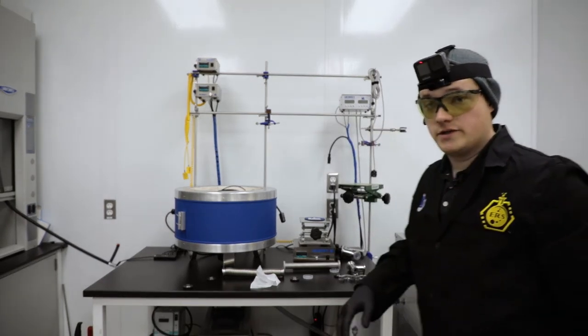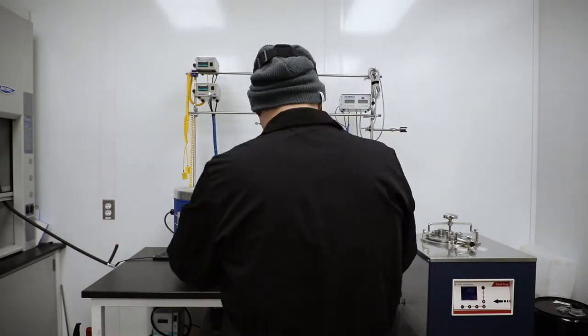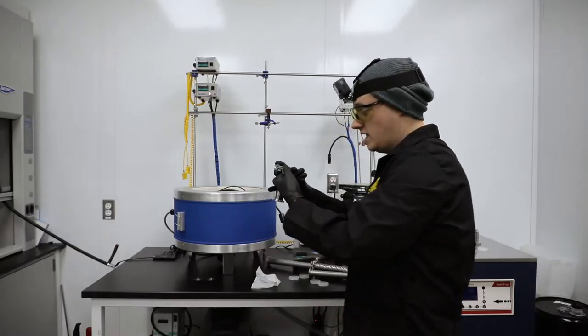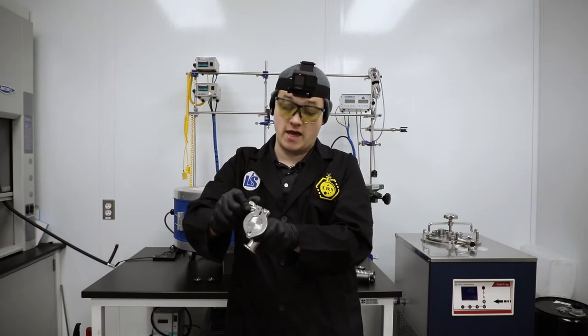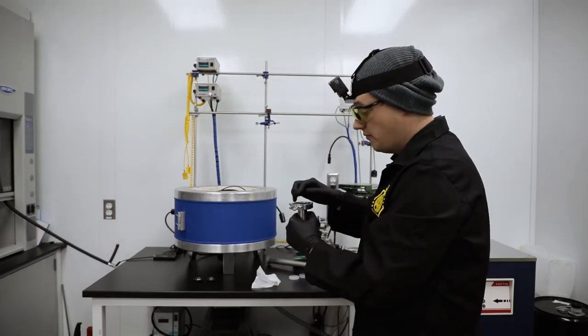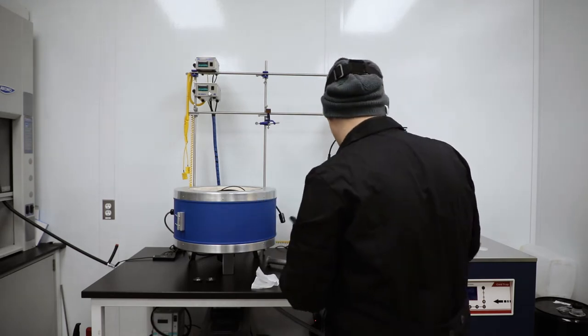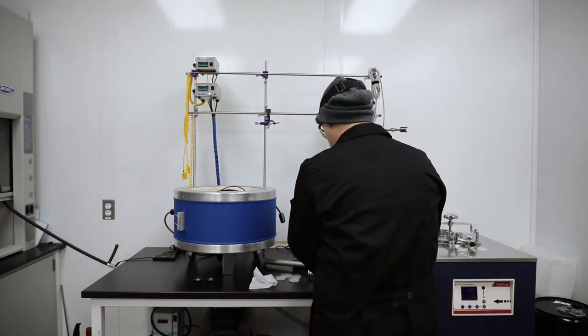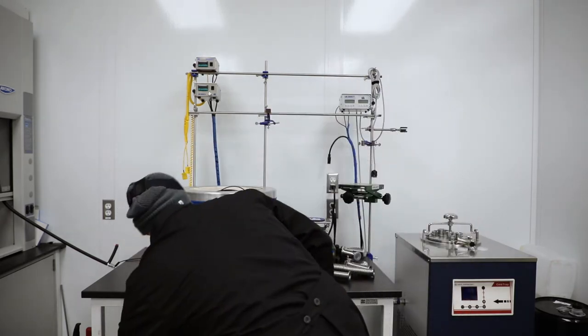So now that I've got all my parts, I can start assembling. All of these clamps, we want to make sure that they're hand tight. We don't want to wrench them down with wrenches because if you do that, you risk the potential of actually cracking these aluminum clamps. They're aluminum and honestly just a little bit of force will seal them. And you can actually test that out with your vacuum sensors. So no reason to crank them down and break them.